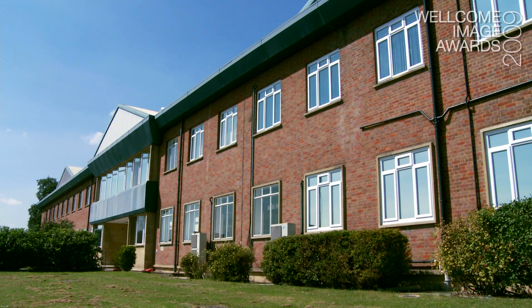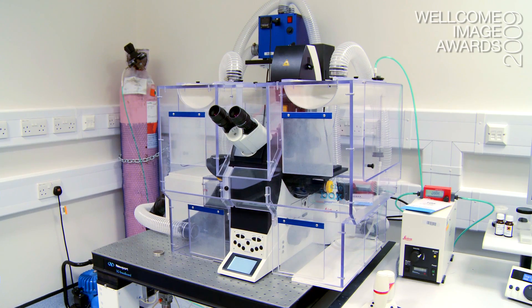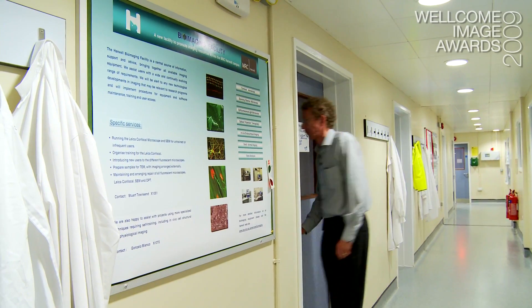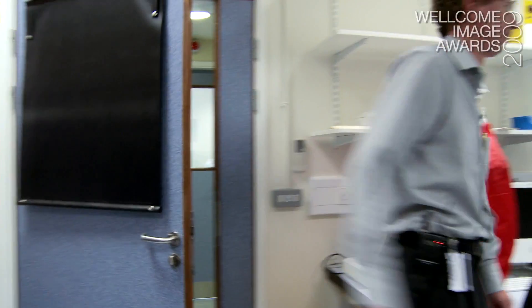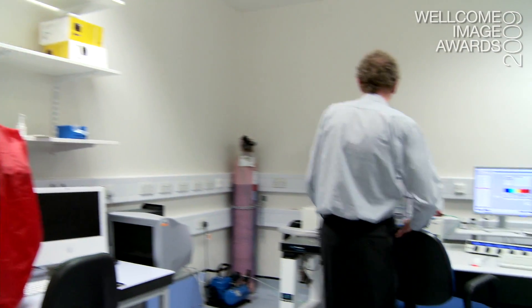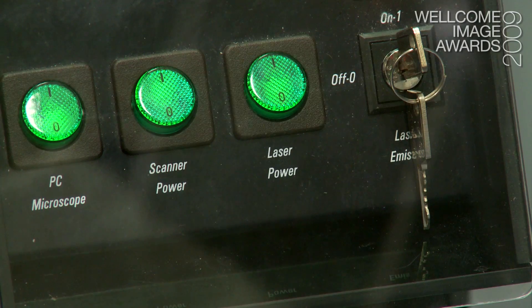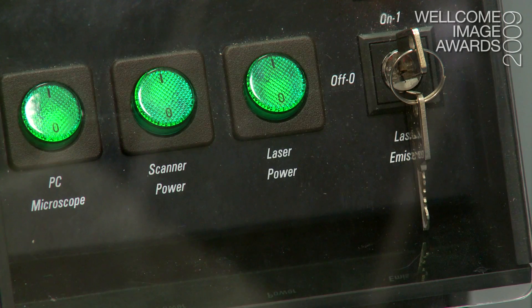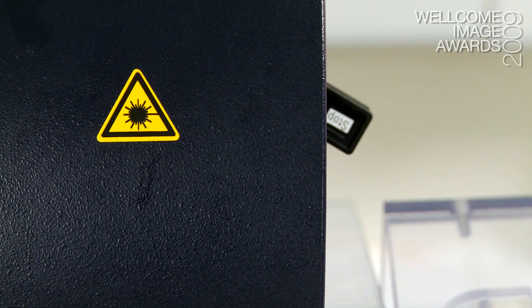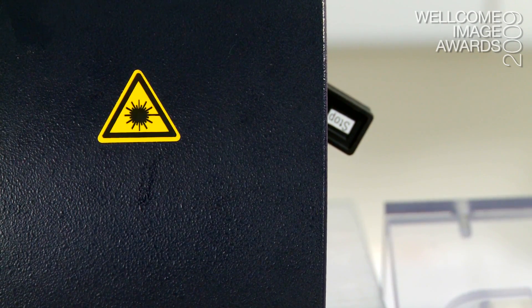It's essentially a standard fluorescent microscope but instead of using a white light source, like a light bulb, to illuminate your sample, you're using lasers of various colours to illuminate your sample and to get the information from the sample.